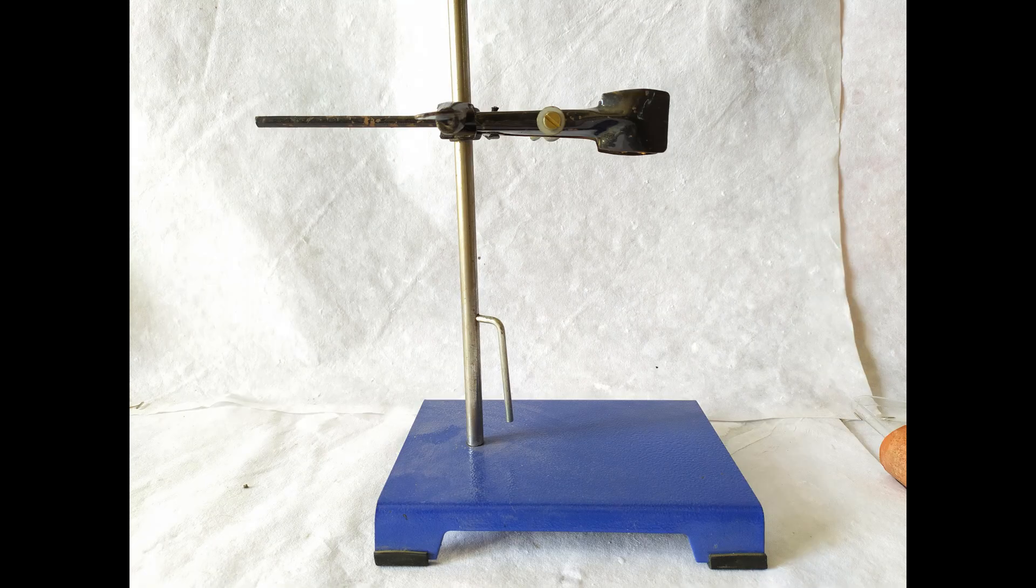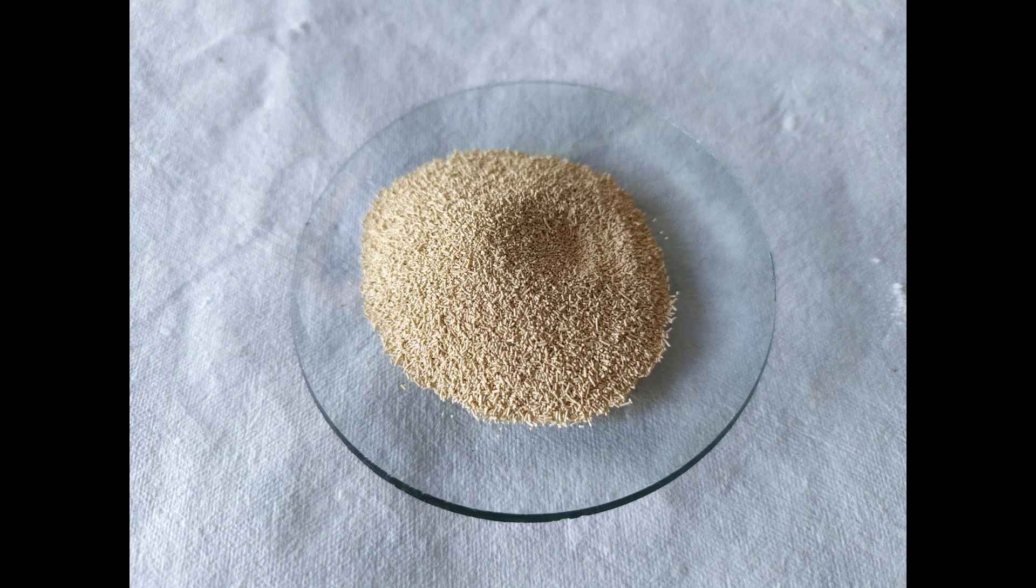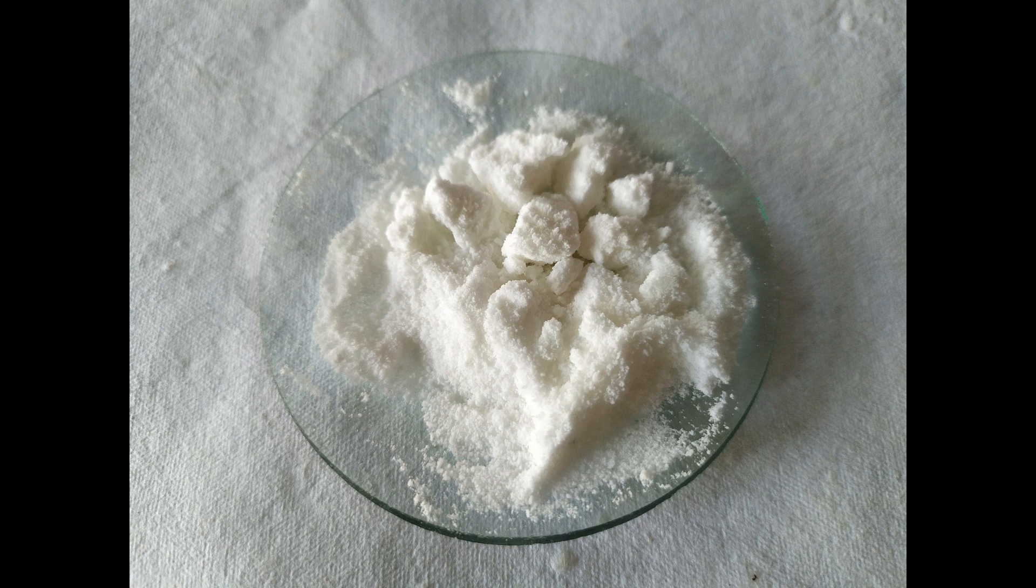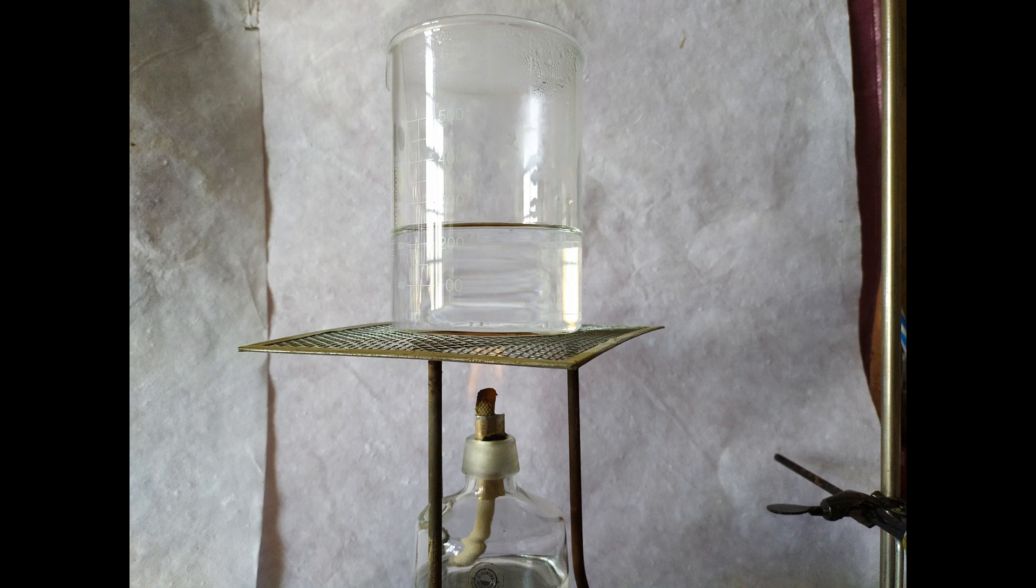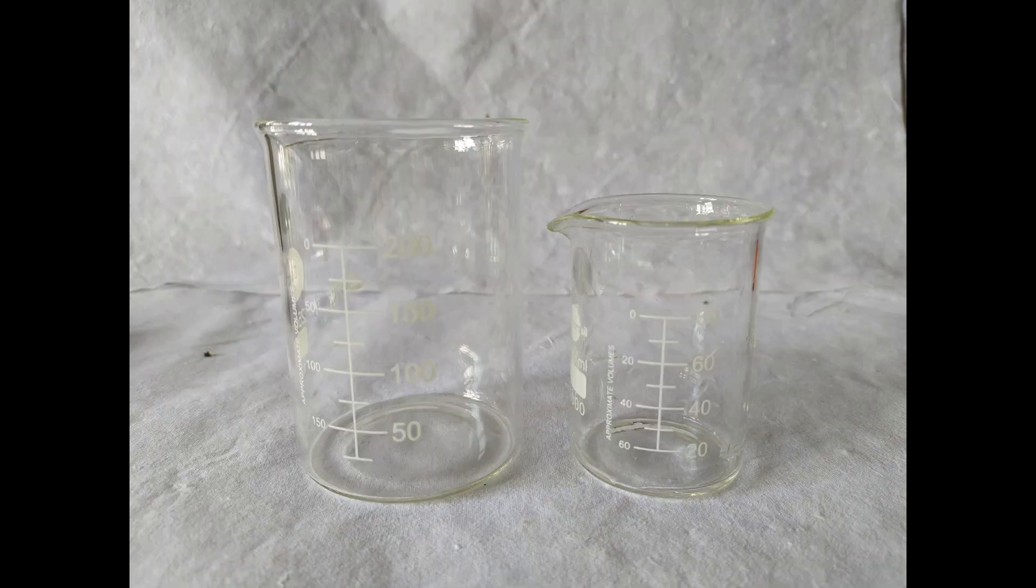A clamp stand, dry baker's yeast powder, glucose powder, lime water, paraffin liquid or cooking oil, boiled and cooled water, beakers, and stirring rods.